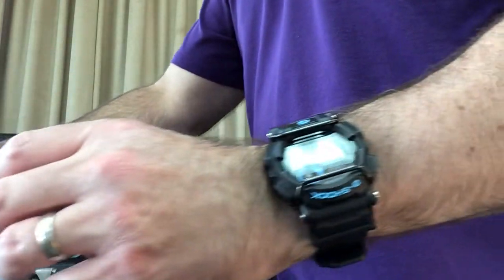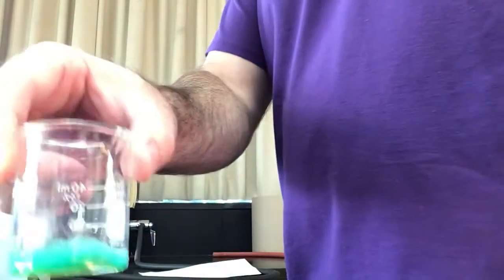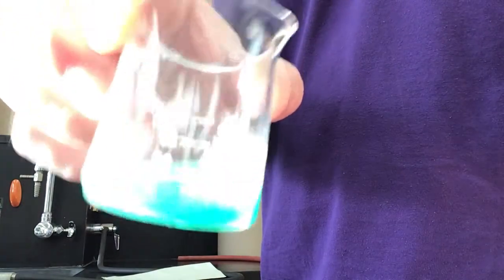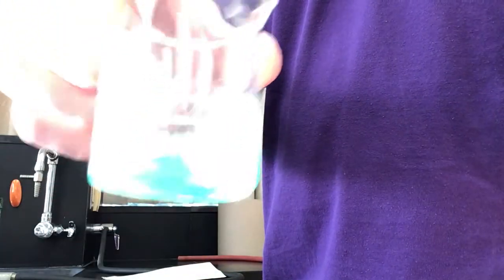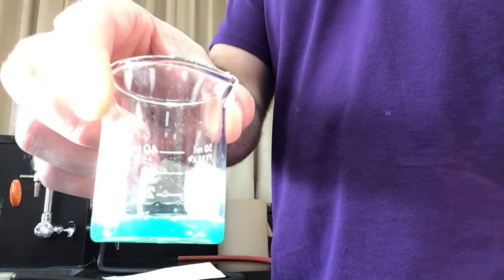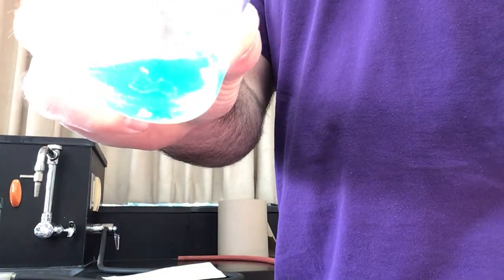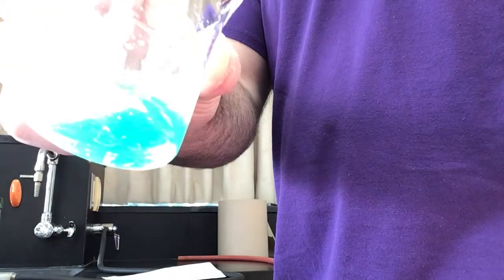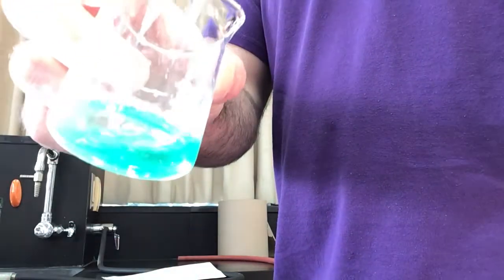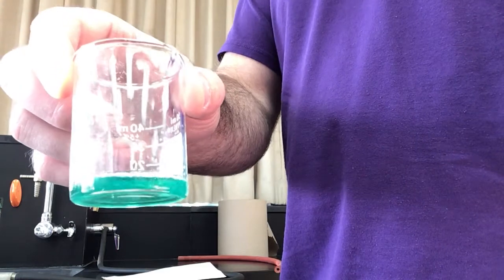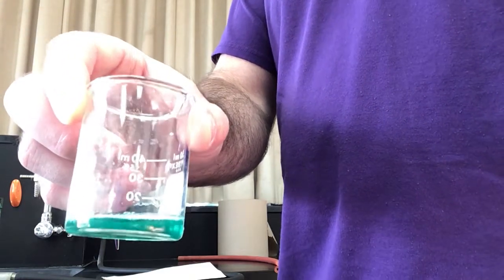We've got our solution here and you may notice it's turning kind of a greenish color similar to what we had when it was a hydrate. We're going to dissolve this, and it's pretty much all dissolved with that small amount of water, which is great. We get to see the green color there.